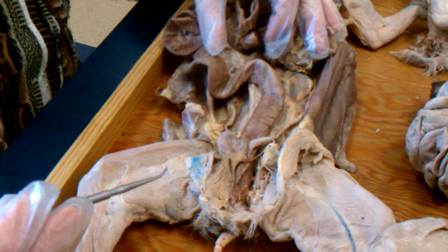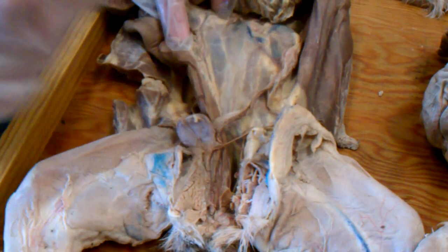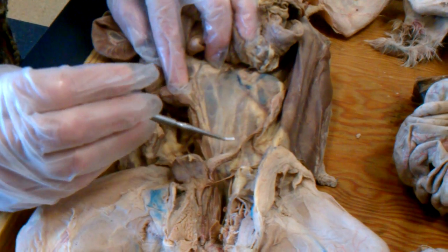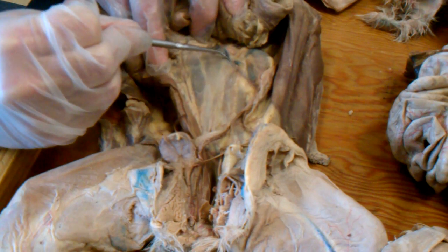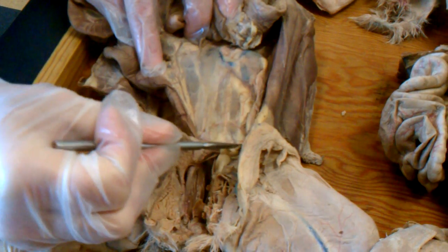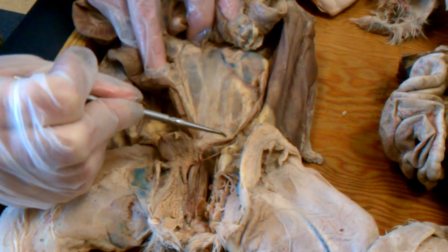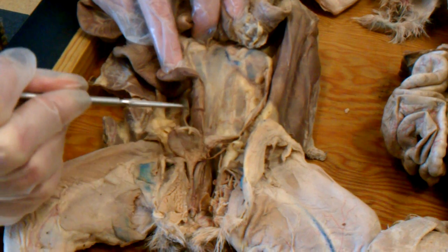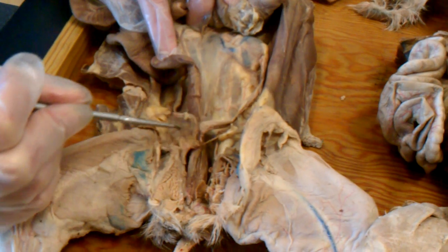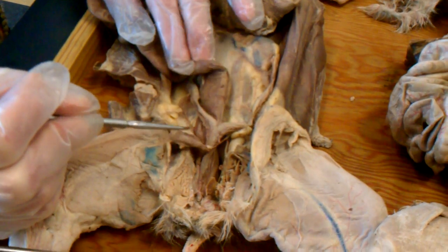Okay, female cat. And again, we'll pull all the digestive organs off to the right. Here's the left kidney. This cat has not been dissected, but you can still see the renal vein through the peritoneum. And also, you can see the ureter, that yellow structure, coming down through or under the peritoneum to empty into the urinary bladder laterally, although we have cut the lateral ligament of the bladder on this cat. And of course, there was one on the right side as well.